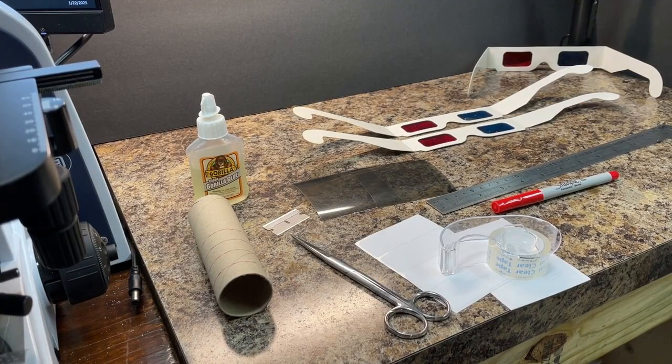If you want to view samples in 3D on a computer monitor, you'll need 3 pairs of 3D glasses with cardboard frames, available cheap on everyone's favorite online shopping service. This Anaglyph system works fine, but the polarization system gives better color, so I'll show that first.